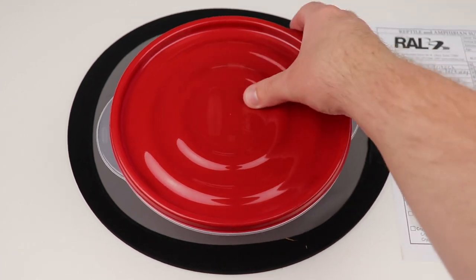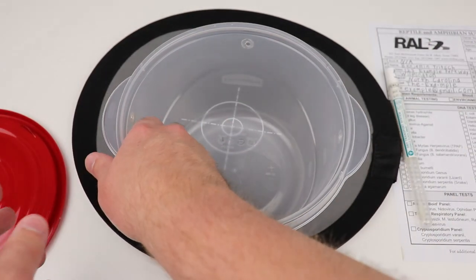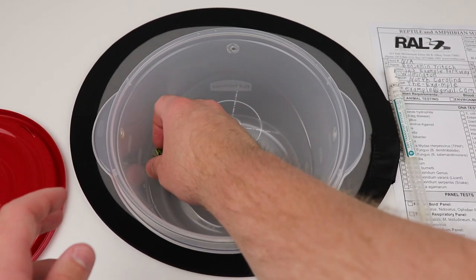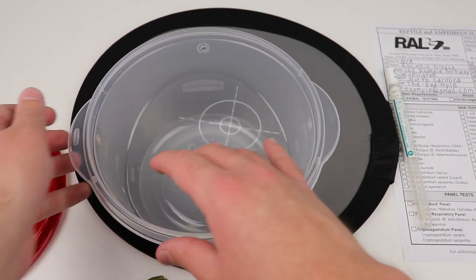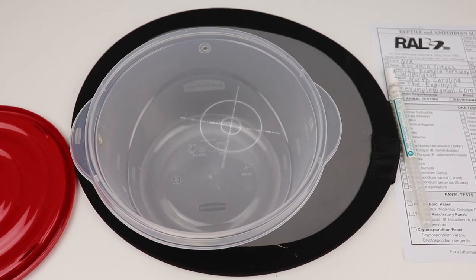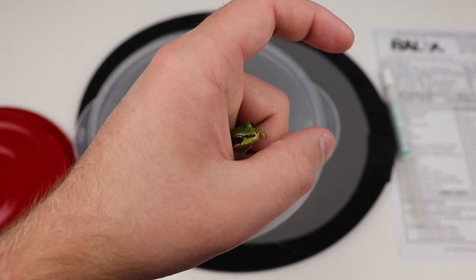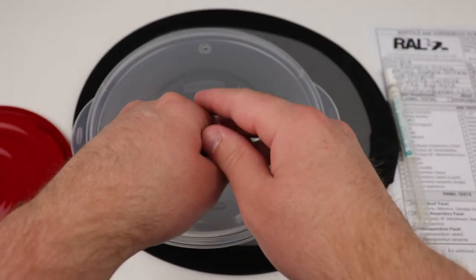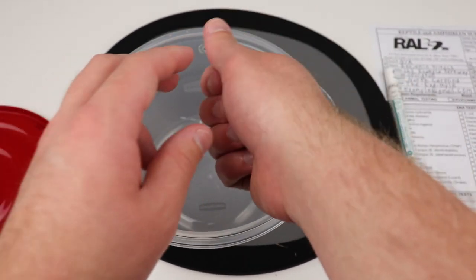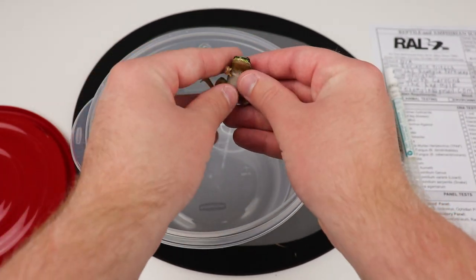Let's get right into it. Take the animal you suspect may be infected with chytrid. In this case, these are sierran chorus frogs — a very interesting and beautiful species. Some in this shipment were wild caught, some captive bred. These guys have already been tested and are chytrid free, but we're going to show how we do this just for the sake of the video.